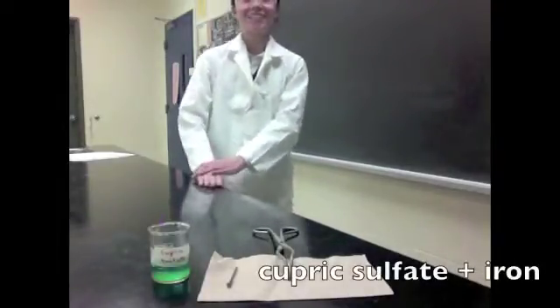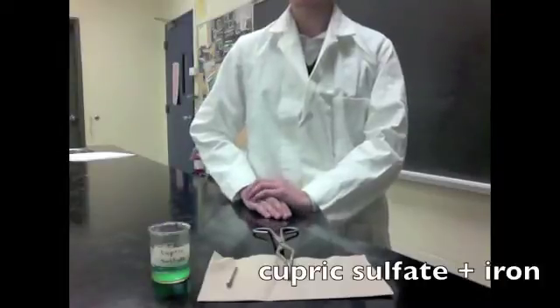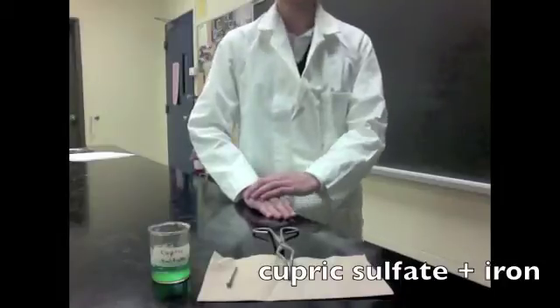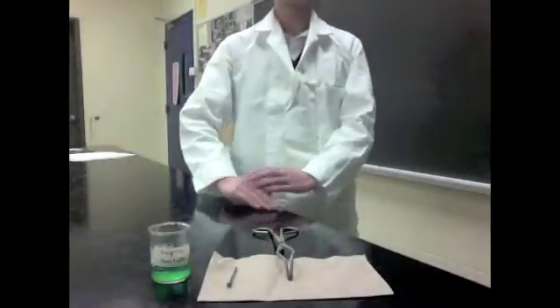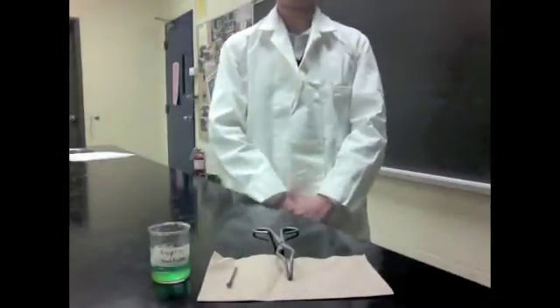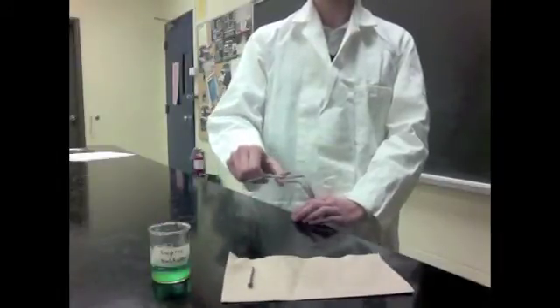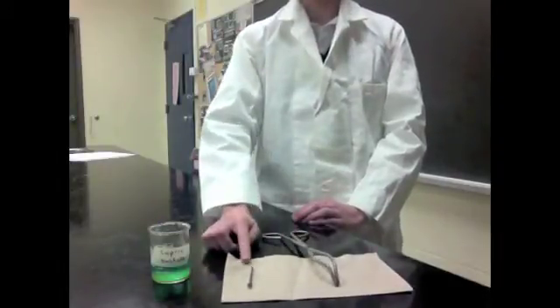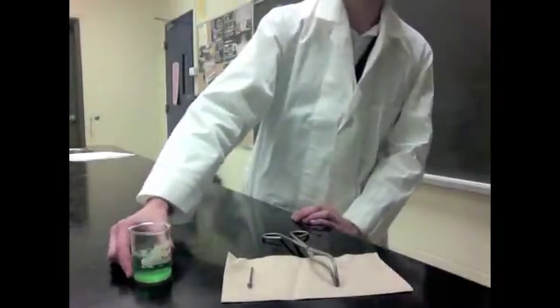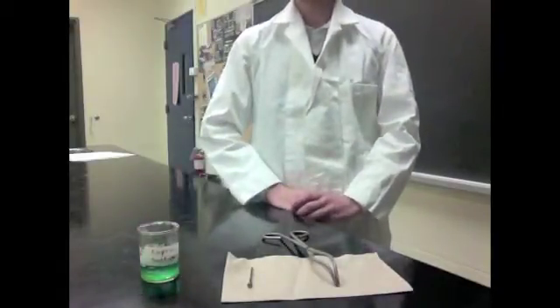Hi class, my name is Danielle, and today I'm going to be conducting an experiment called the Copper Sulfate and Iron Experiment. So for this lab, you will need your safety goggles. Girls, you will also need to tie up your hair so that you don't damage your hair. And we are also going to need a pair of tongs, an iron nail, and your teacher will supply you with a beaker full of Copper Sulfate.